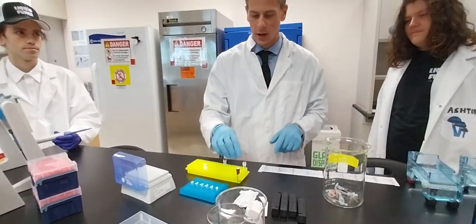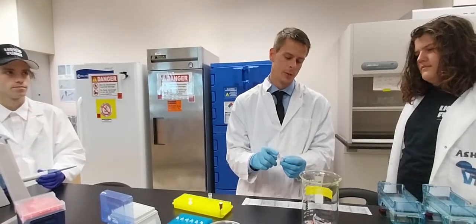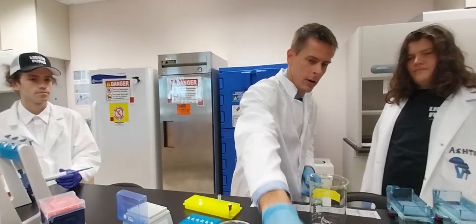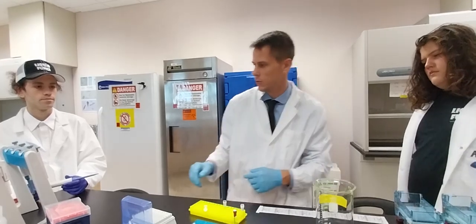So I'm going to show you guys, I'm just going to do one. And what we're going to do first is we're going to put 5 microliters of this 100 base pair ladder in one, two, three, and four wells. Two outside lanes, both of these. I'll do the first one.